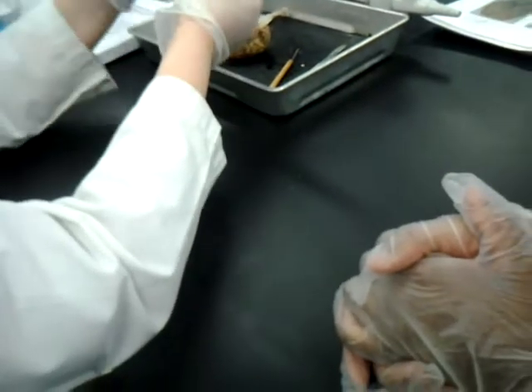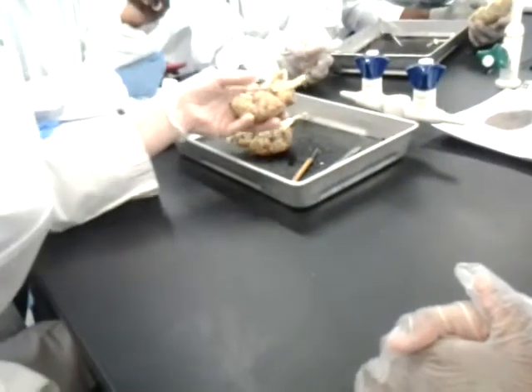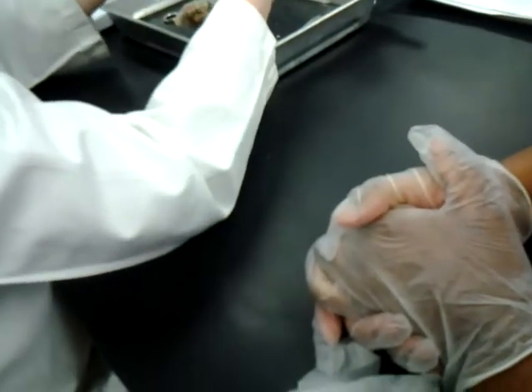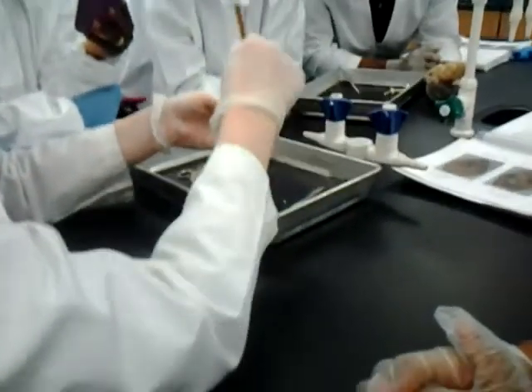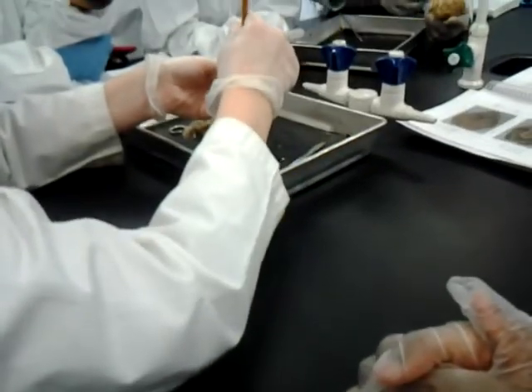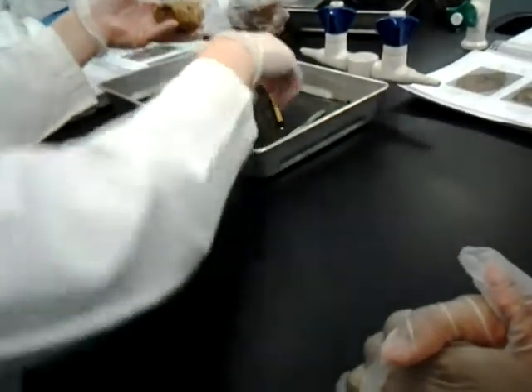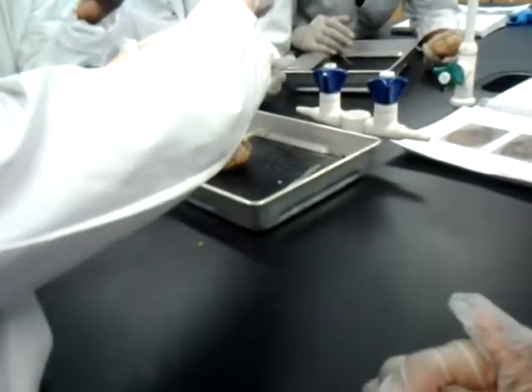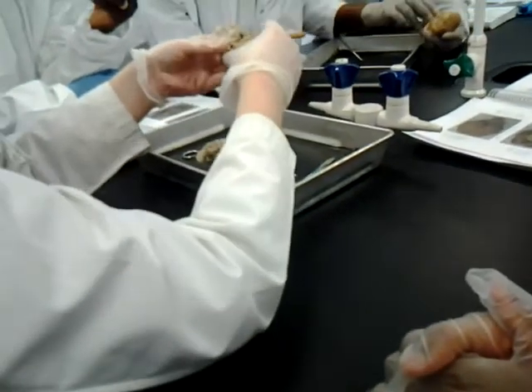Now it's off. What I do want to point out is the pituitary gland. The pituitary gland is actually within this mess of stuff. It is right here. But you're going to end up removing it, so you don't have to identify it. I'm just letting you know, hey, that's where it is.